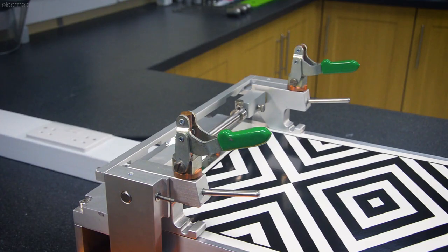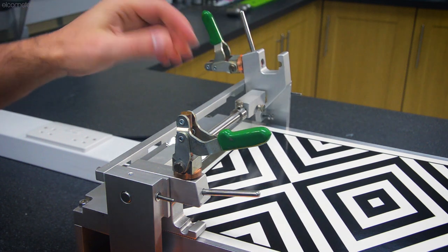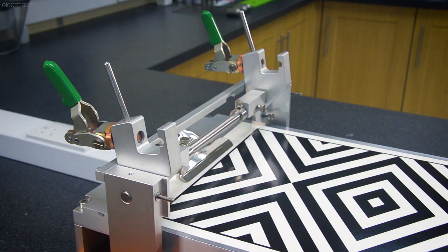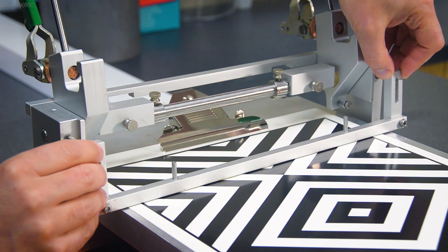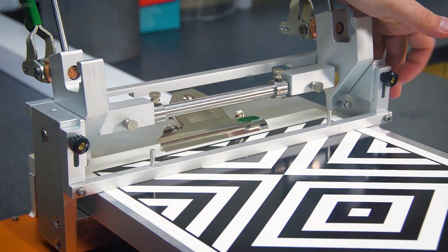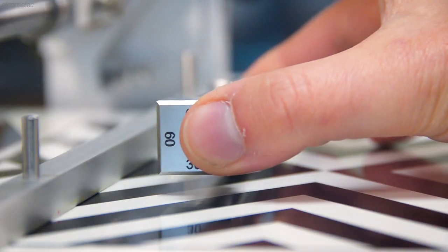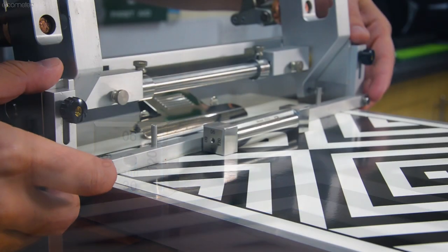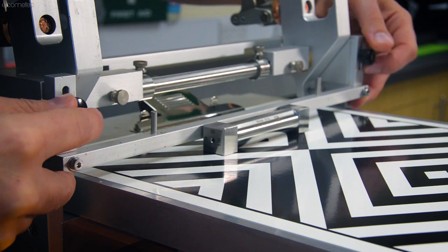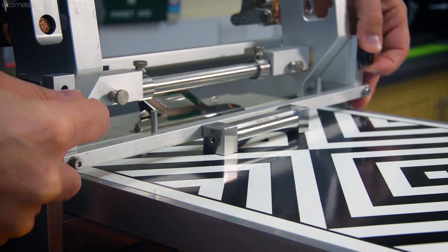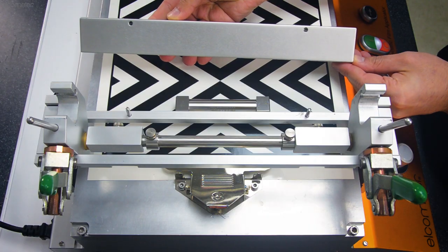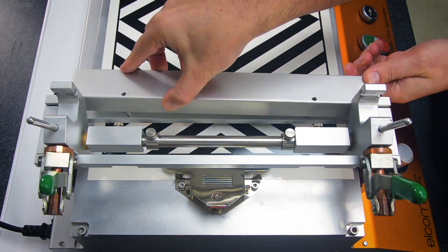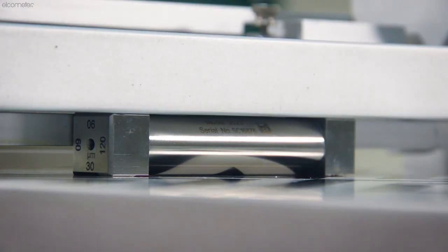To use the majority of film applicators, rotate the carriage to the raised position, fit the applicator pushing bar into position using the knurled screws, and place the applicator on the substrate until it's touching the pushing bar, ensuring the pushing bar is the correct height. This can be adjusted using the screws. When using a lightweight applicator such as the baker, place the supplied weight onto the two locating pegs, ensuring the applicator remains firmly in contact with the substrate.